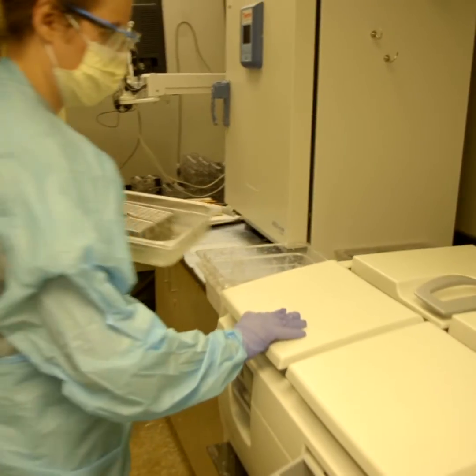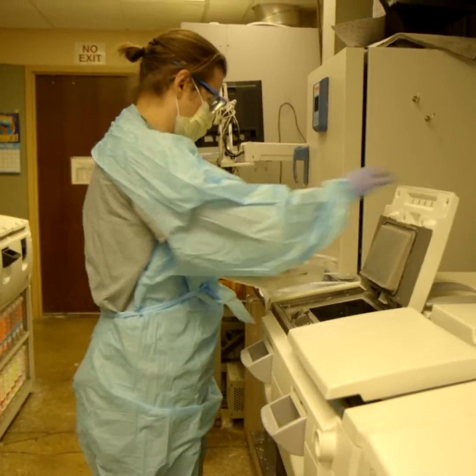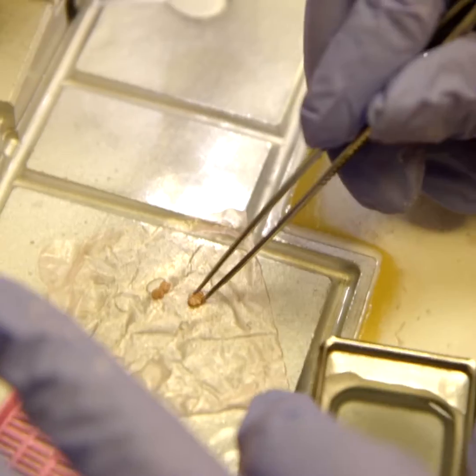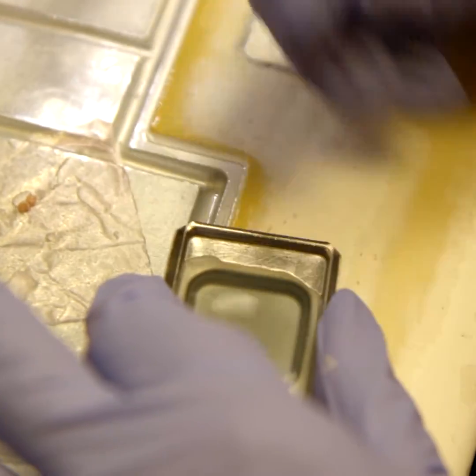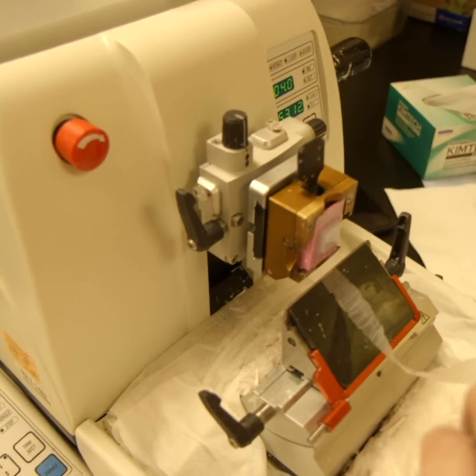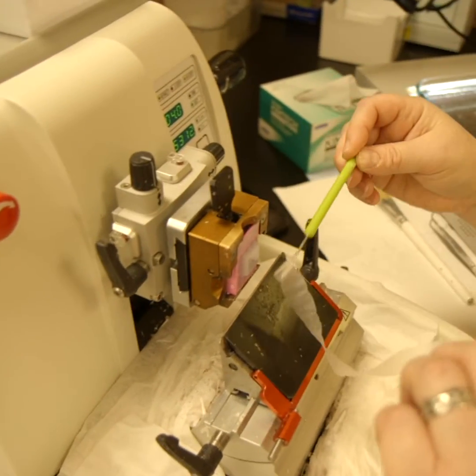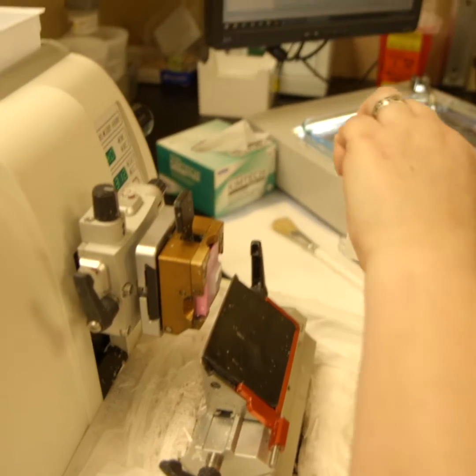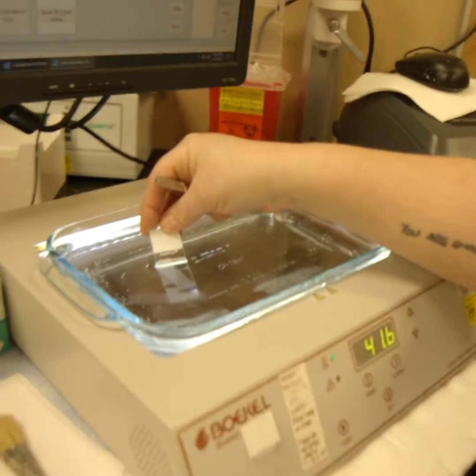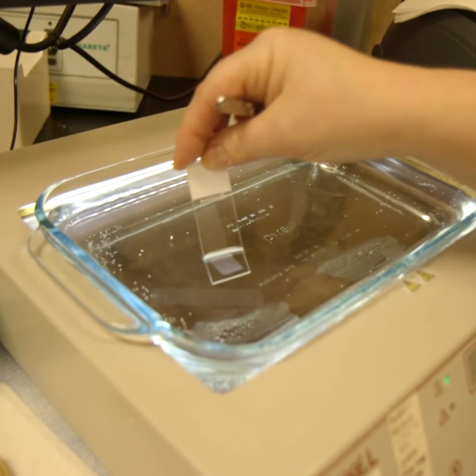After a specimen is placed in a cassette, it needs to be processed. Processing means we take it from something that's in formalin and move it to a wax process — it goes through a series of chemical baths and then comes out so it can be embedded in wax. That cassette, after it's embedded, is placed on a microtome. Histotechnologists will take that tissue and, using the microtome, bring it about four microns forward to a blade at a time, then take that section off onto a slide.